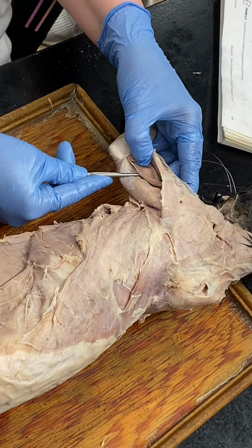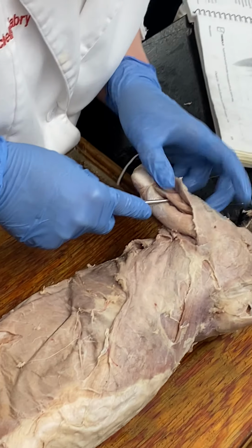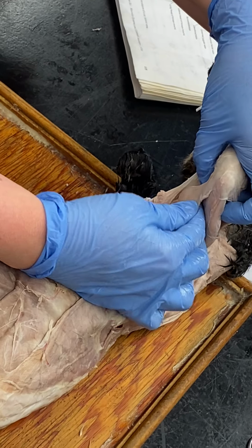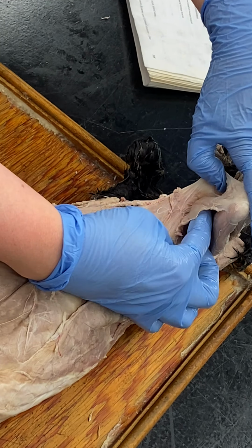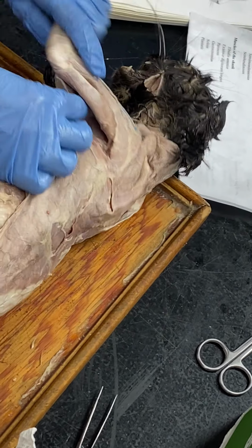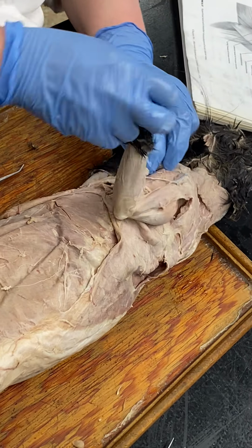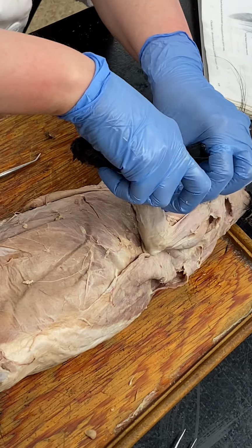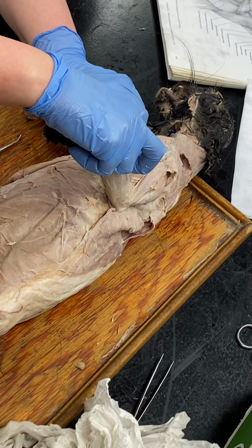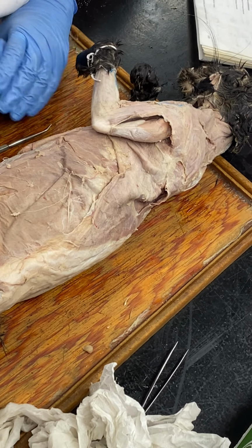These are the ones kind of buried. Medial triceps. Epitrochlearis. This little flat guy. Epitrochlearis. Flat guy right there. And then biceps brachii, you know where those are going to be. Biceps brachii. Okay. And come back for version 2 and we'll do the hind limb.